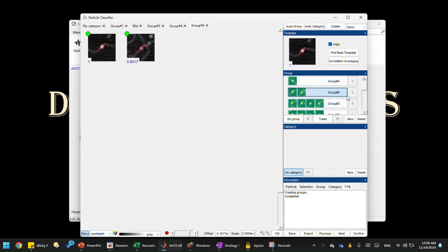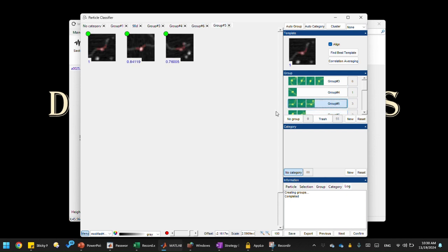Let's go back to sort by name. So we already examined groups 3, 4, and 6. Let's go to group 5. Group 5 is like a bent state. Yes, let's sort by correlation to group 5. Yeah, 45 degrees, see? The 45 degree is closely related to group 5. This is like a bent state, 45 degree.